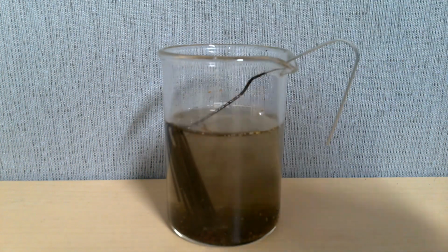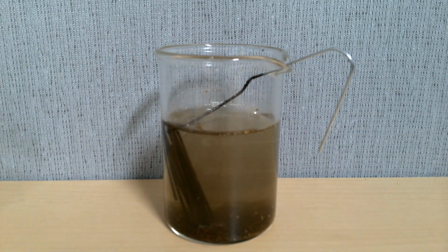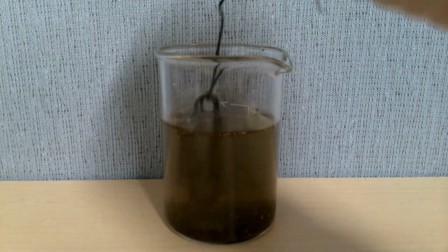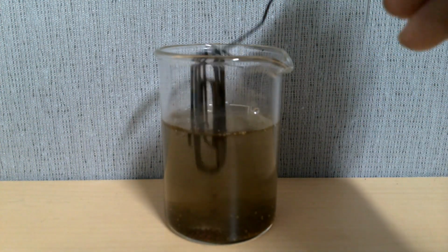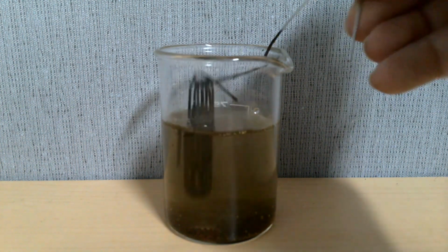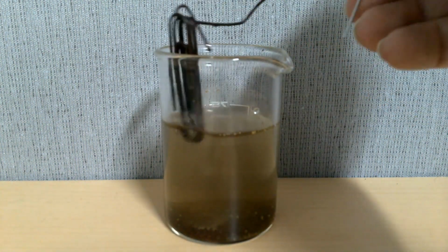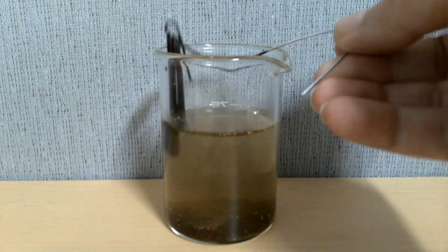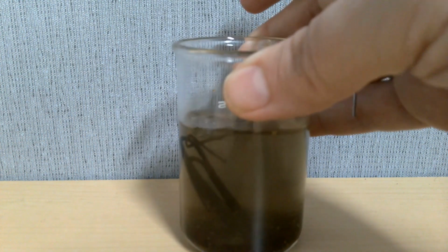And that's why, since the iron's not blue when it's dissolved, this is no longer blue in color. So the dissolved copper was blue and the dissolved iron is not. So you could actually tell the concentration difference based on the reaction by the fact that there's no blue left in this solution. And all that's left is the copper that was removed from the solution. And it's all down there. You could gather the copper and measure it if you would want to.